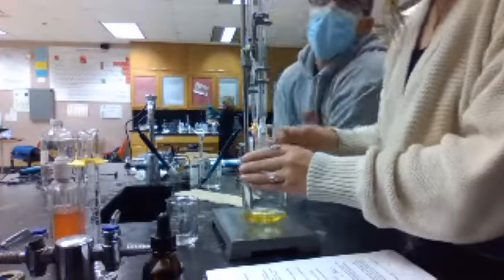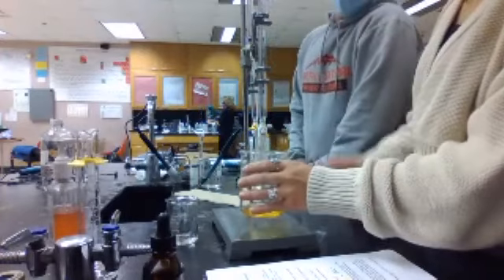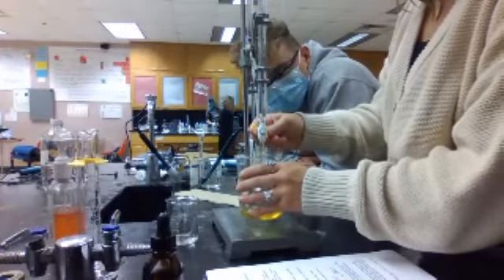What do you guys say, 7 point what? 8.4, so we're already over that. So it's bound to happen pretty quickly. Oof. Sorry.